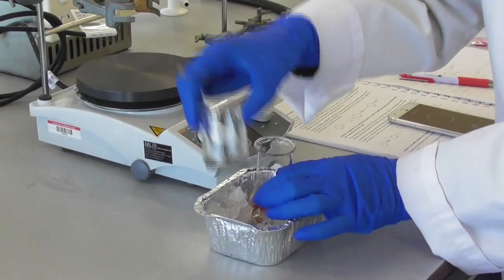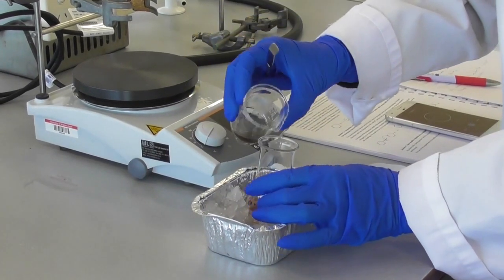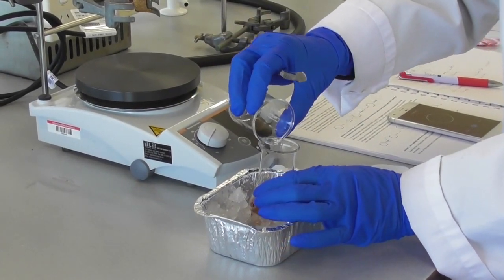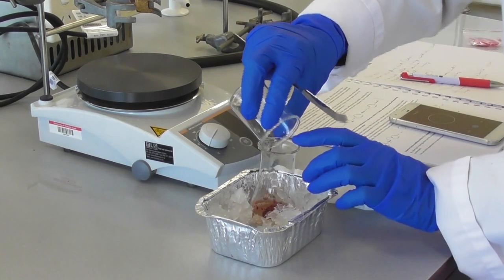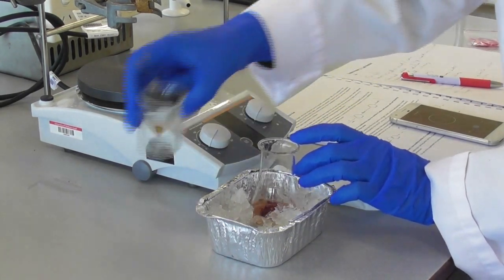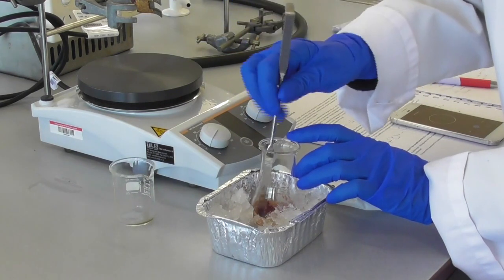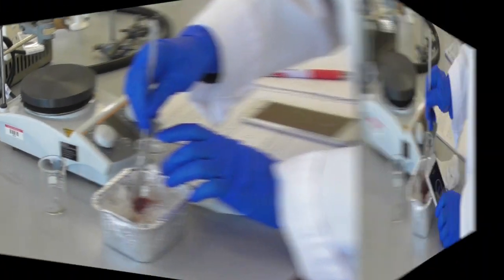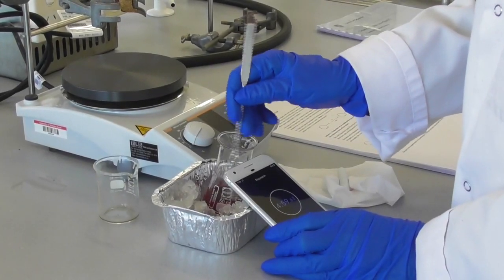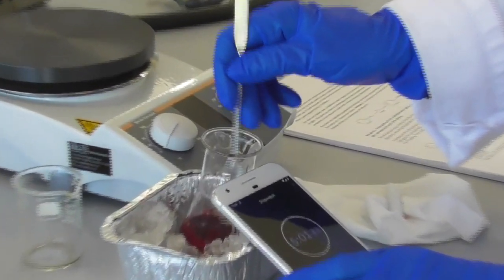After 5 minutes I remove both solutions from the stirrer, remove the stir bar and add the naphthol solution into my reaction flask. I keep stirring the mixture for another 5 minutes in the ice bath.